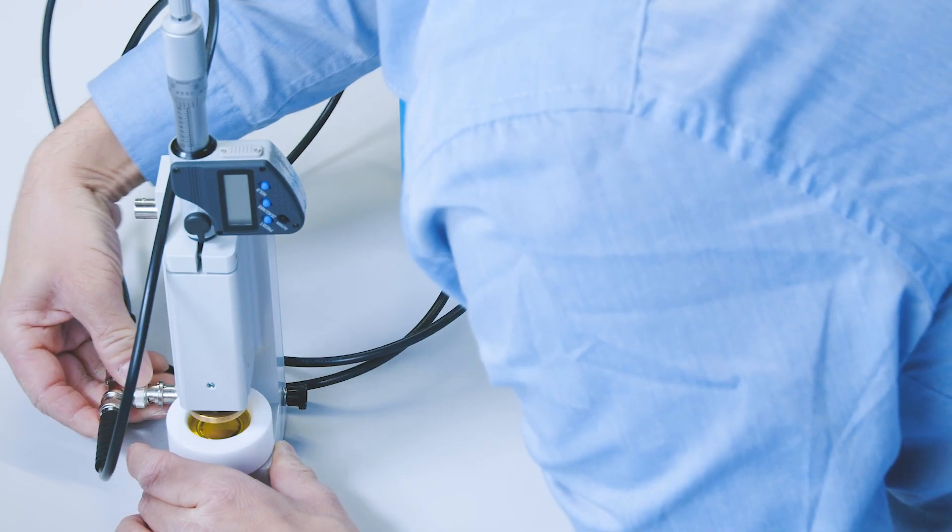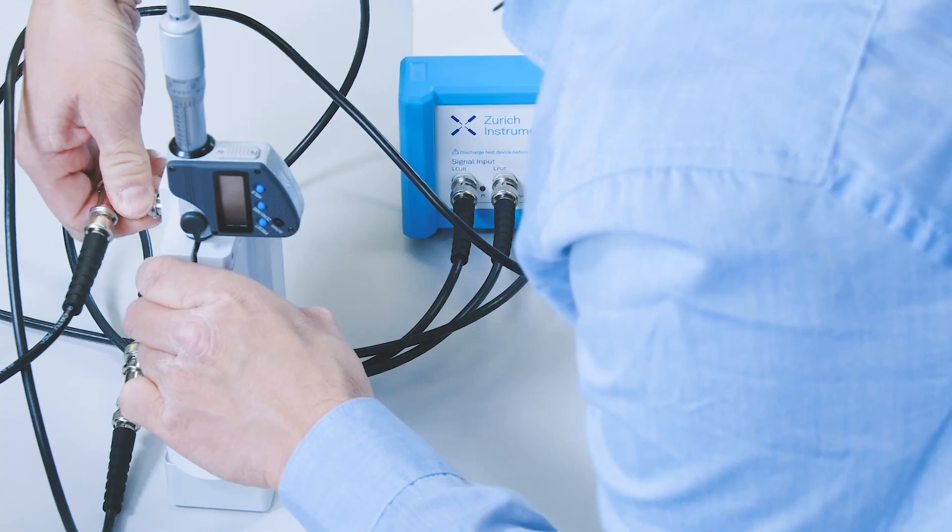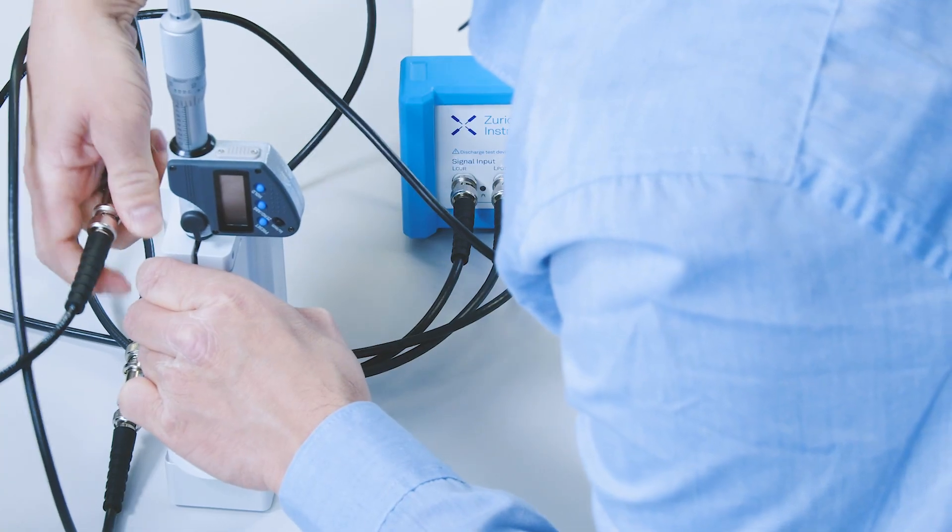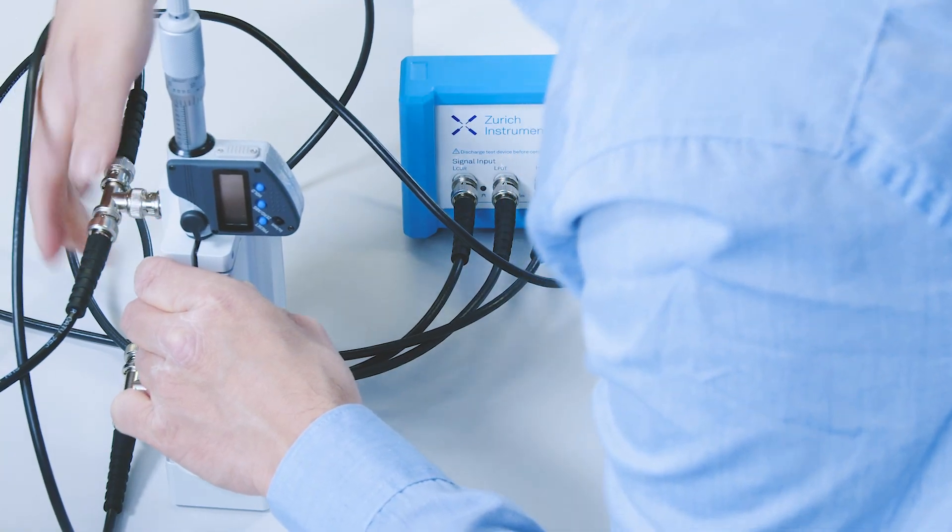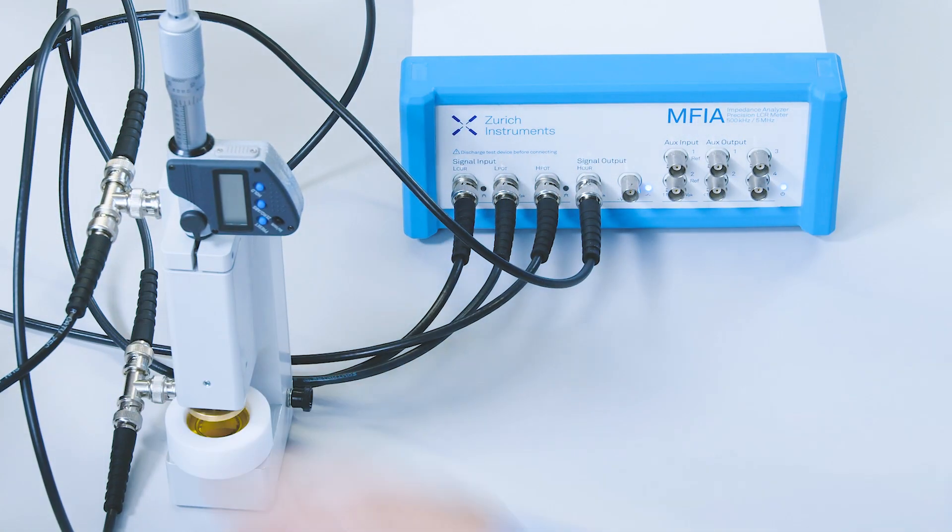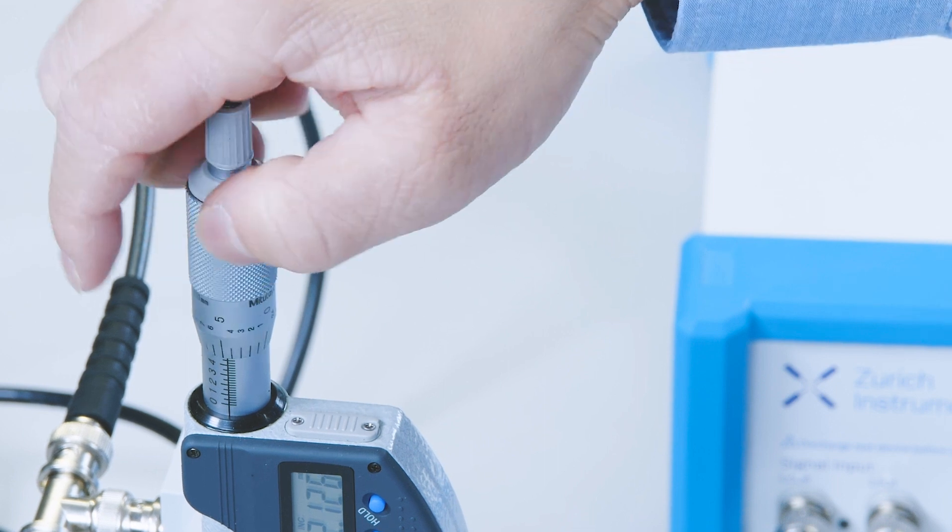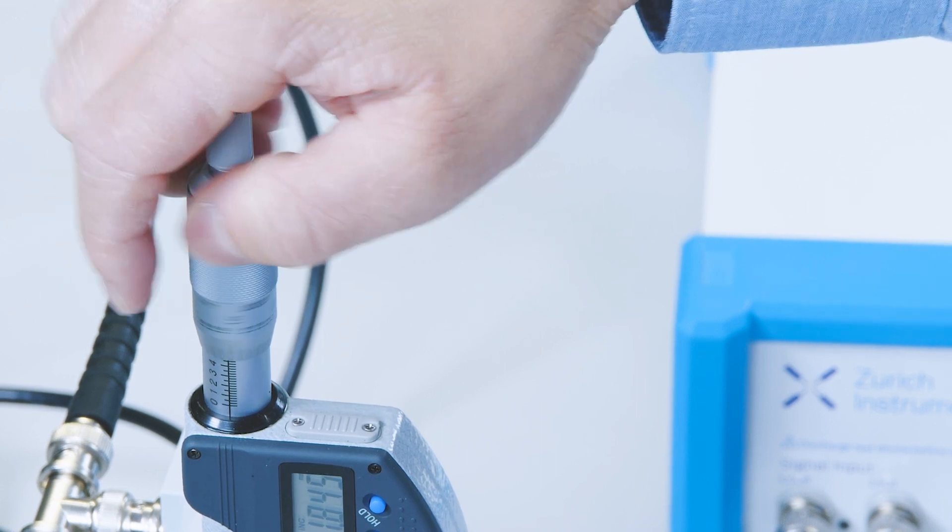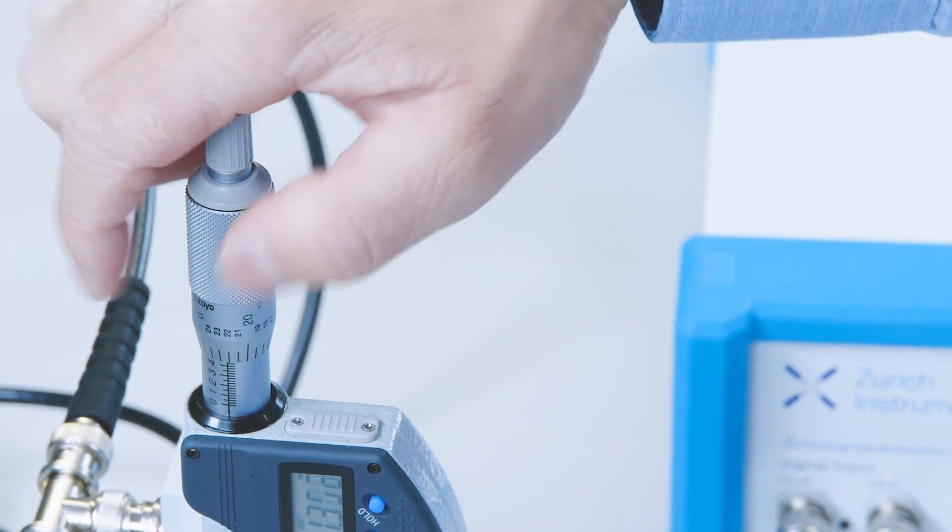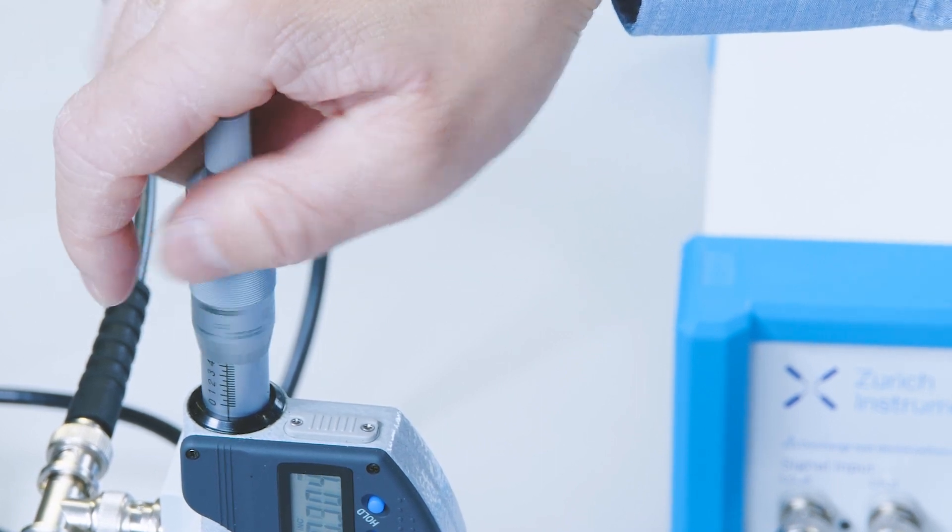Now I'm going to connect to the dielectric fixture and lower the electrodes to touch my liquid of interest. A dielectric fixture allows us to calculate the dielectric properties more accurately. The parasitic impedance between the parallel metal plate electrodes is low, and they are made with very high precision, allowing us to get the dielectric properties with higher confidence.